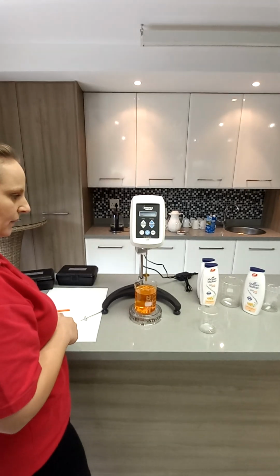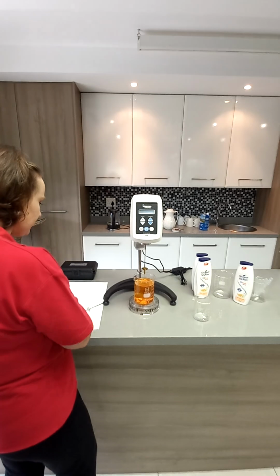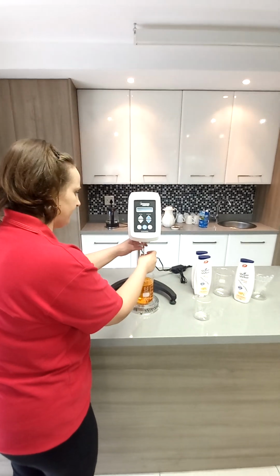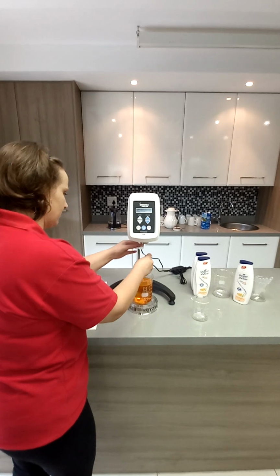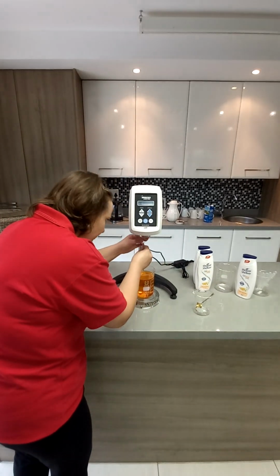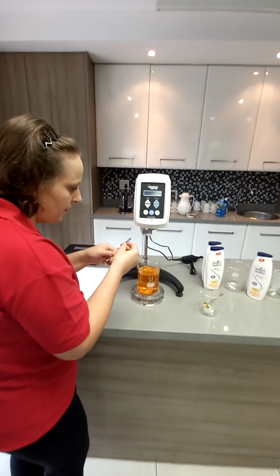So I got a good value for QC checks, but I just want to see if I use a different spindle if I can get a nicer graph. With the creams, you're going to see a nice one. What size is that one now? This is number 5.